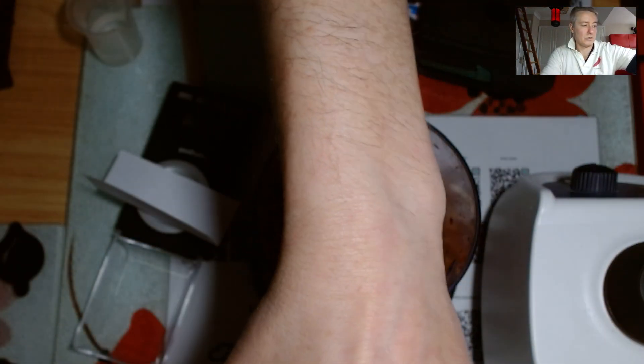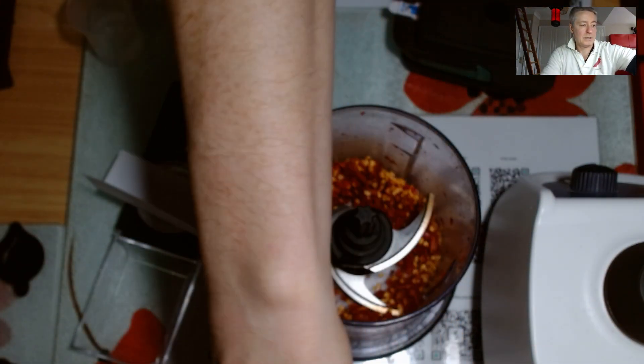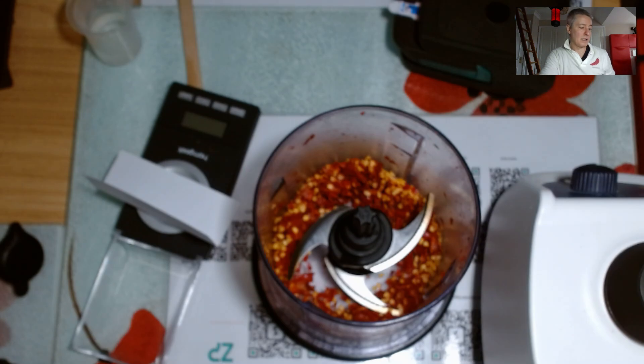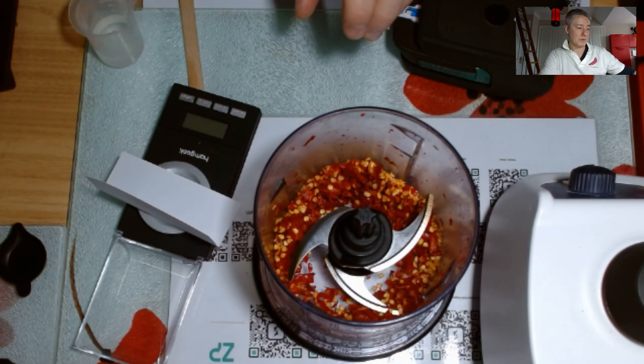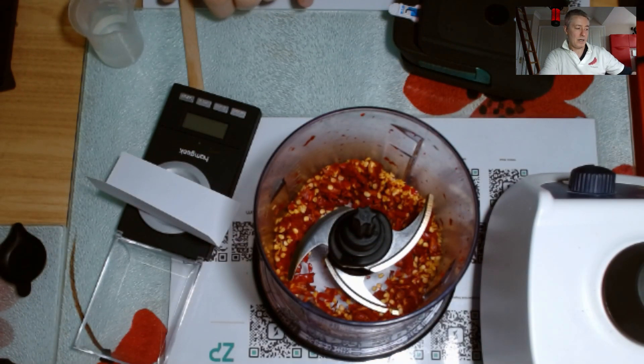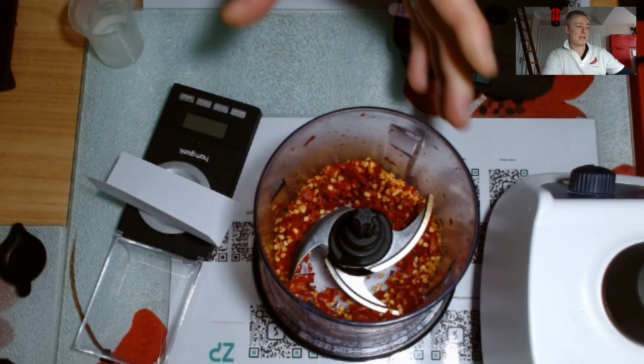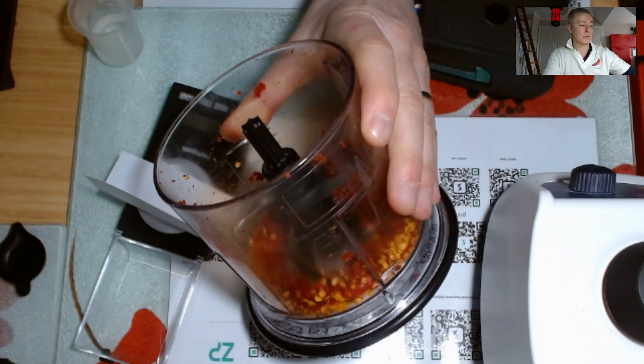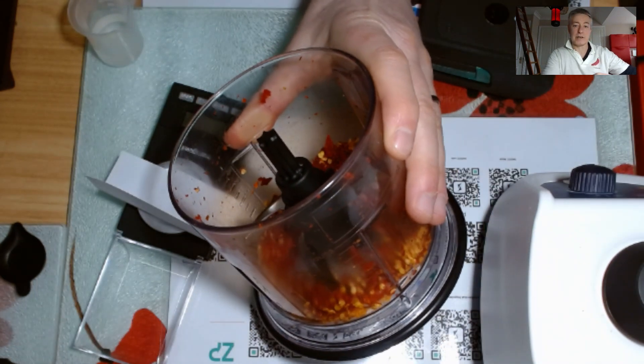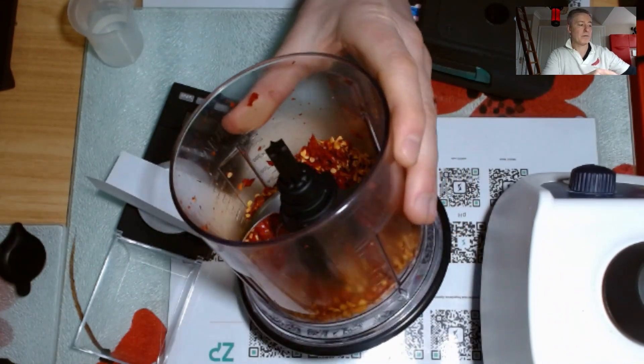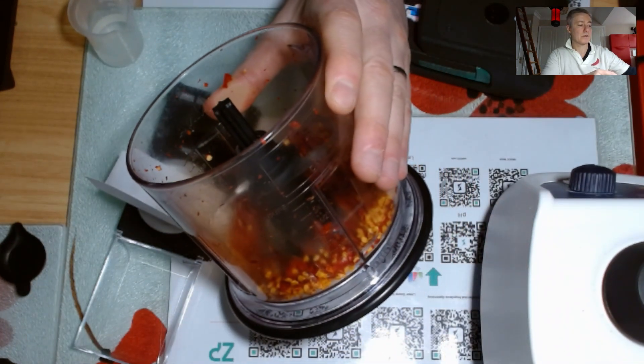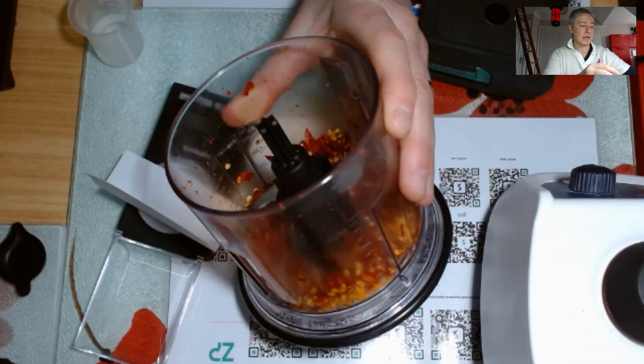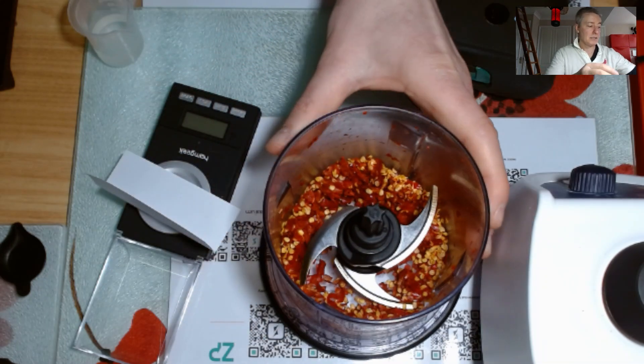Alright, so I'll just give that a quick look. Okay, not too bad, and I have my samples. Now this is not the world's best way of doing this, but I'm doing a live demo. If these were a bit fresher, I think they would have actually broken up a little bit better than this.